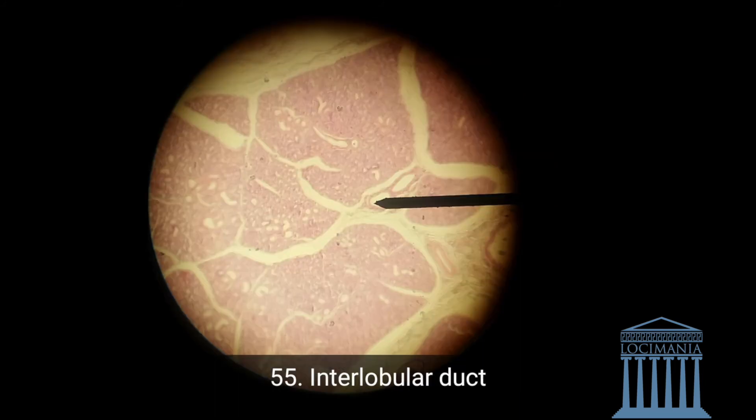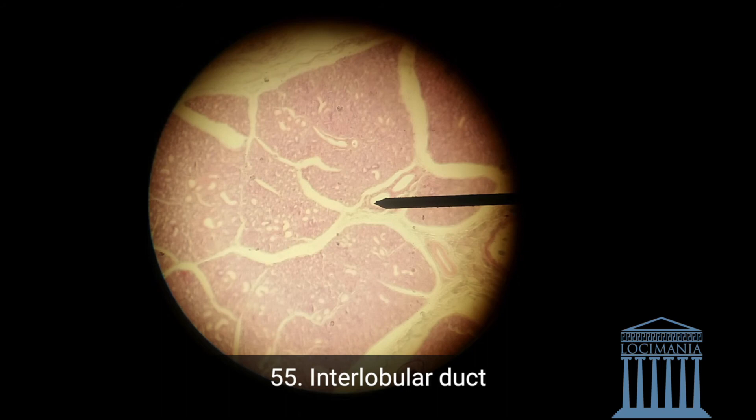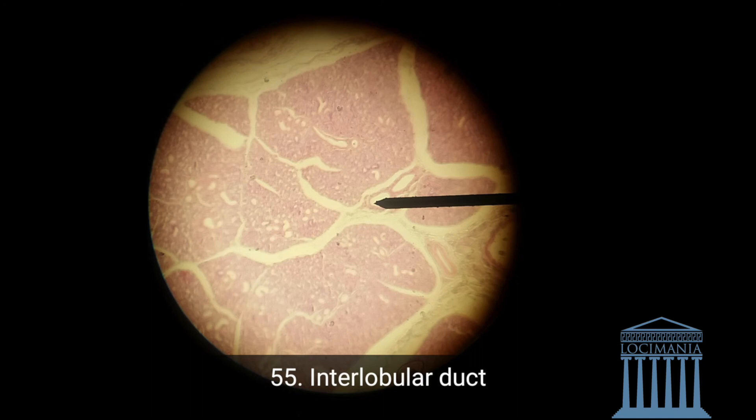Here's another picture — the same picture but at lower magnification. There's the interlobular duct as well.